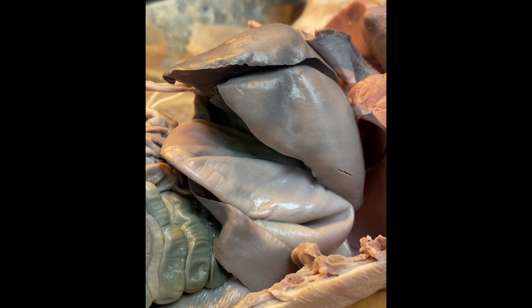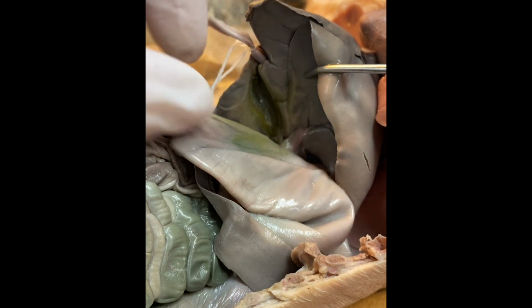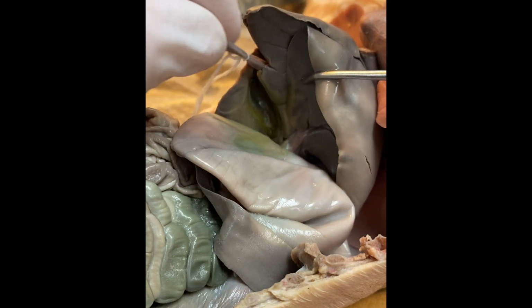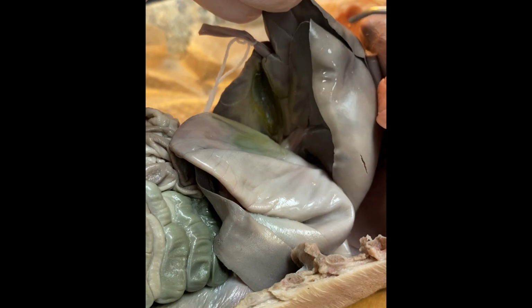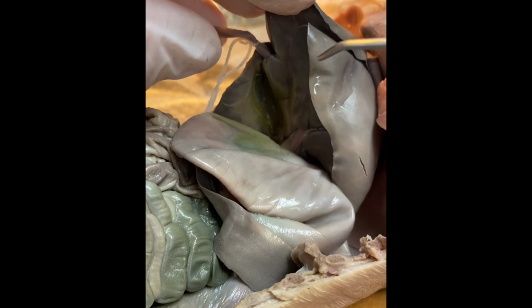What we are taking a look at is the abdominal cavity, and the very first structure that you typically see when you open up any mammal dissection is this large liver. The liver actually has 4 lobes to it, and this is where the umbilical vein connected, and it takes the nutrients to the liver so the liver can process them and then deliver it to the rest of the body.